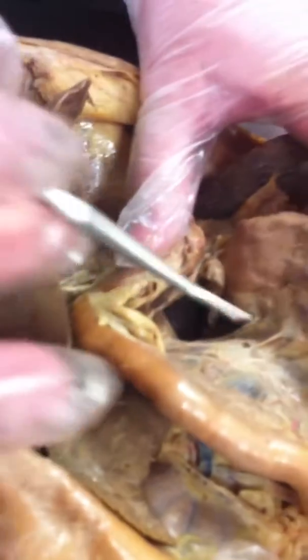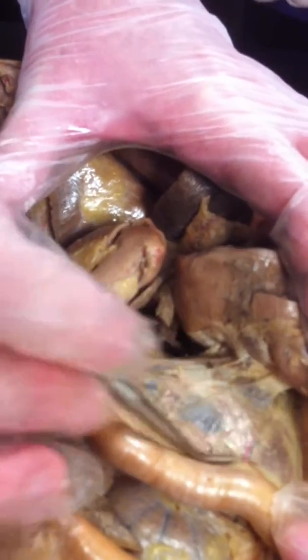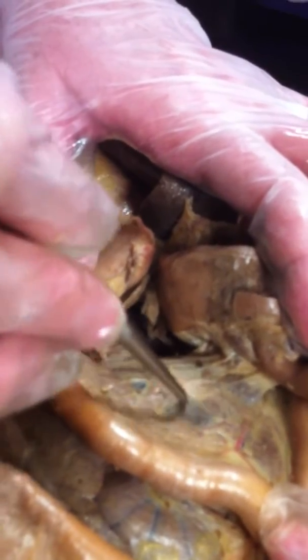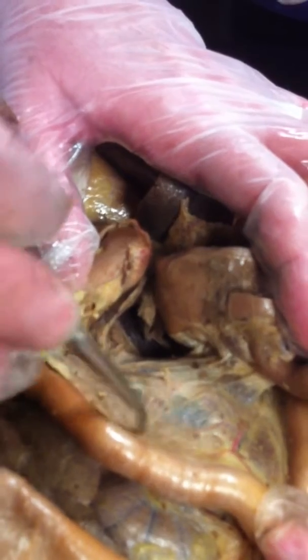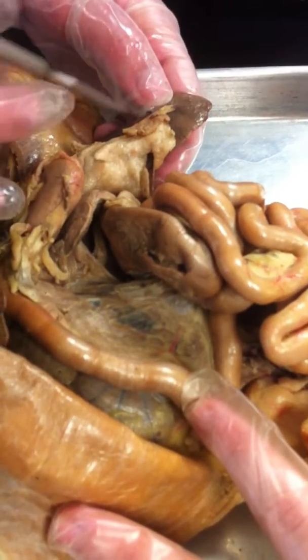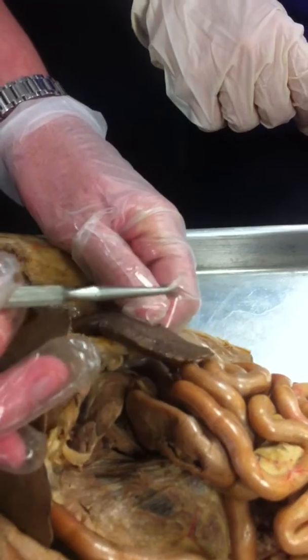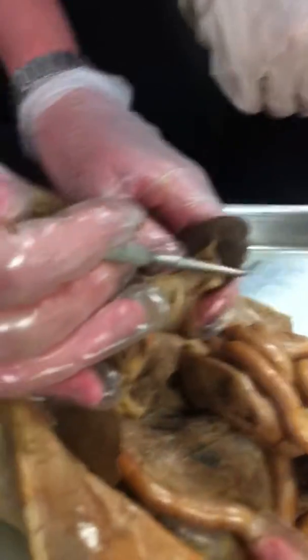Now, also contributing is the pancreas. Here's the pancreas. It's always an unimpressive organ, in my way of thinking, for what all it does. But that's it right here. You can see connective tissue holding it together, but it's that brown tissue-y looking stuff. And then we have the spleen. Now, the spleen is actually considered part of the immune system, but we just study it here, since there's no need to open up the entire body cavity to see the spleen otherwise.